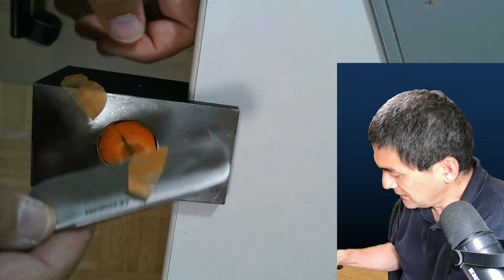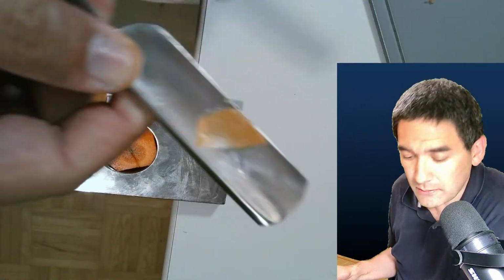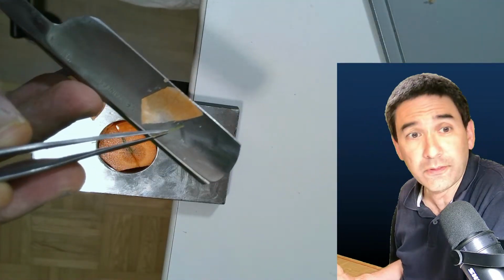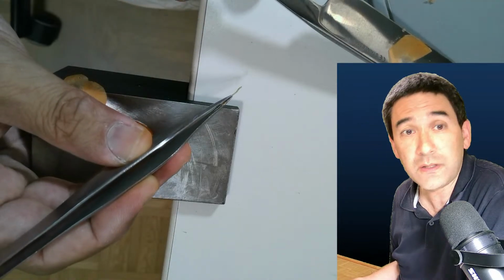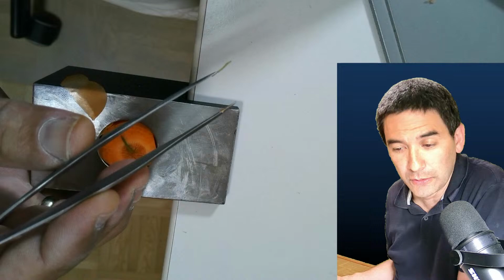Okay, and you can actually see over here, maybe you don't see it, but this one over here, that is the leaf. You know, maybe you need some kind of... no, here it is. Okay. So what do you do with this? We're just going to have a look directly at it.